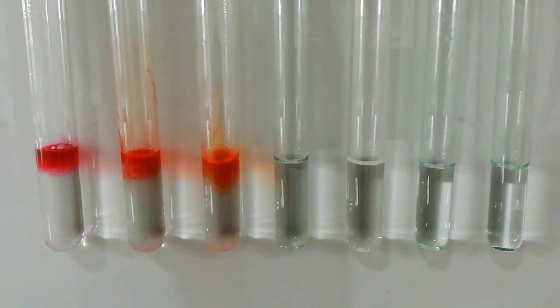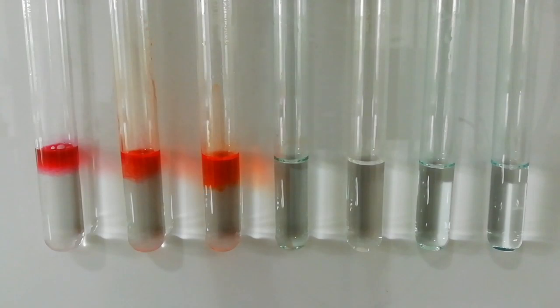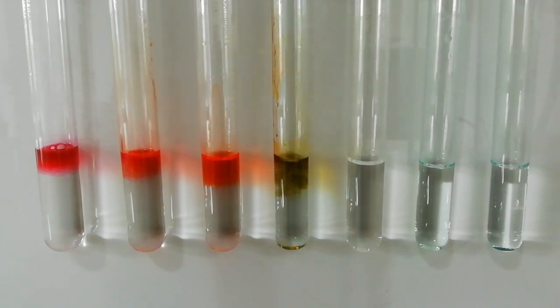The chemicals used for this experiment are shown in the background.